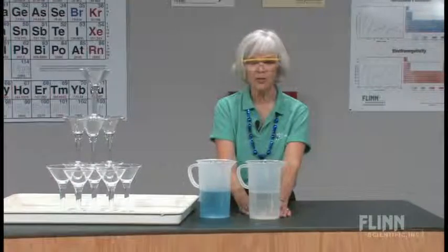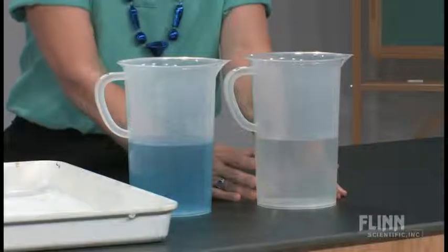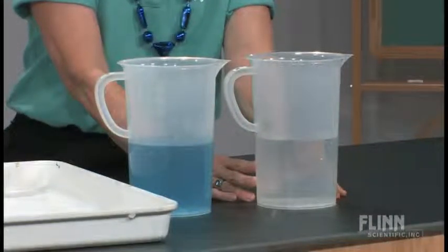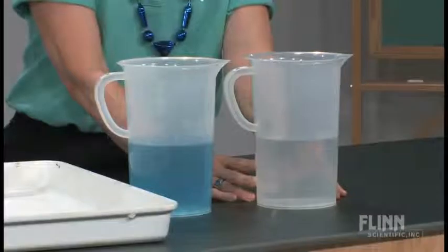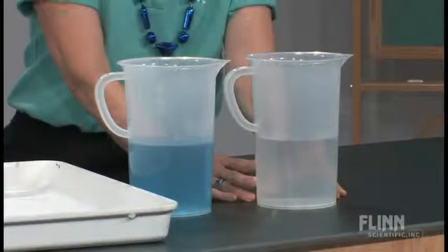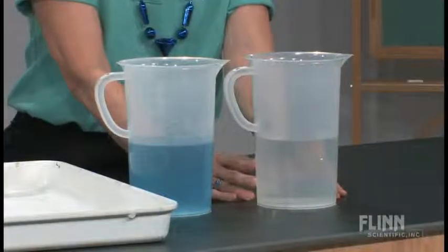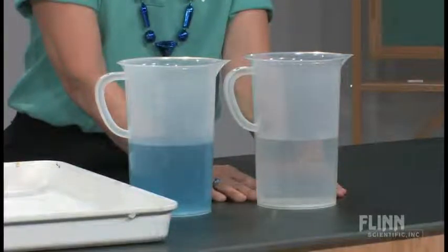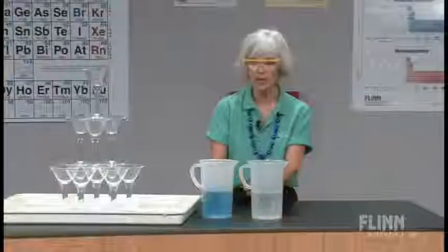In our other beaker, we have a colorless solution. This is three percent hydrogen peroxide — drugstore peroxide — and it has been diluted, so it's even more dilute than regular peroxide.